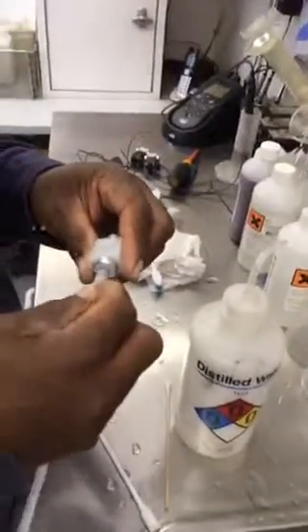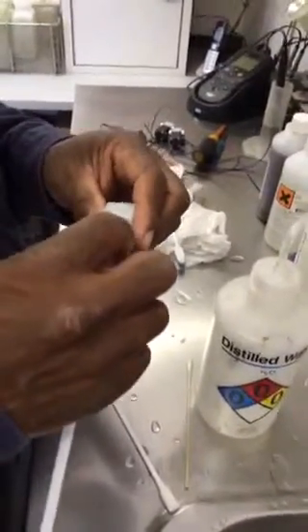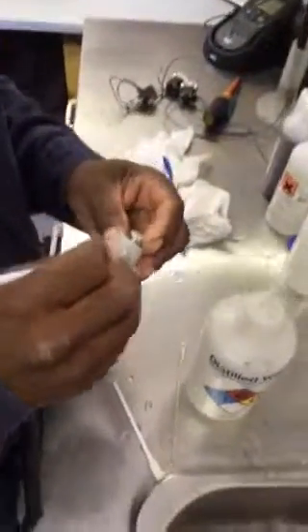So what do you got there, Ken? This is what they call bottle cleaners — it's a tube cleaner. Remember, I think I'd asked Angie about these before — pipe cleaners, that's what they call them. I actually found these that work.